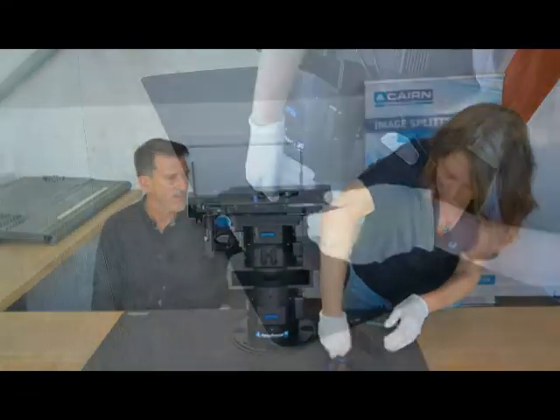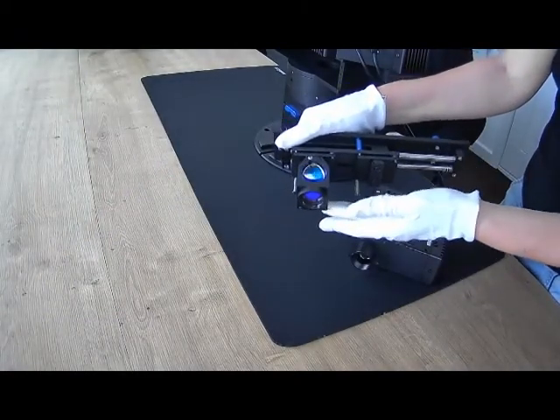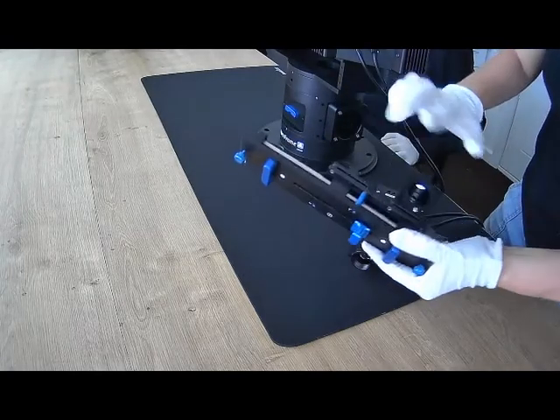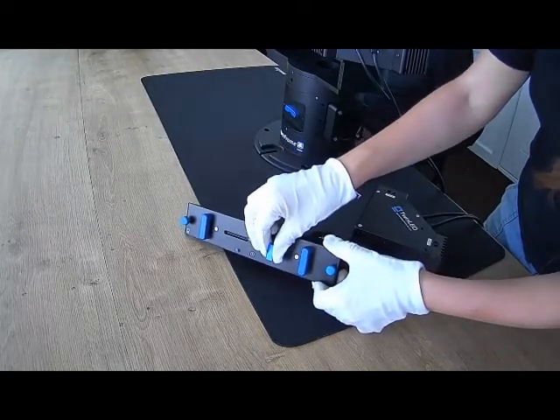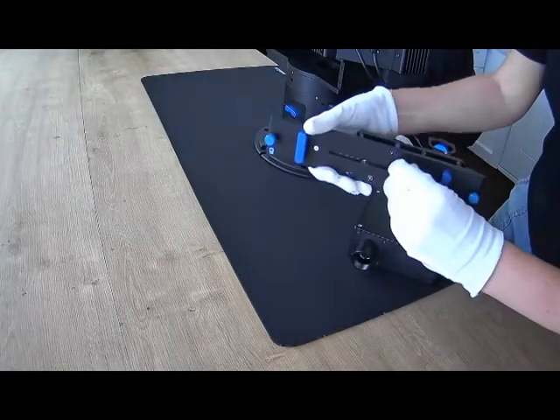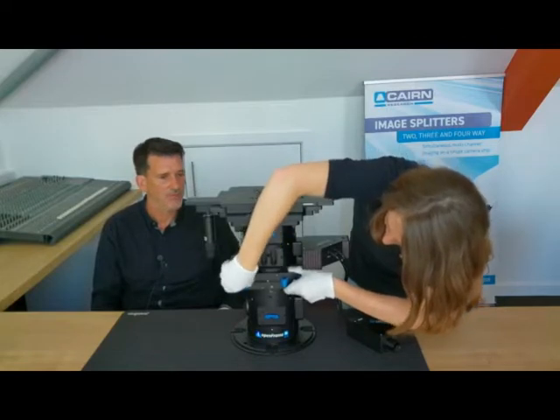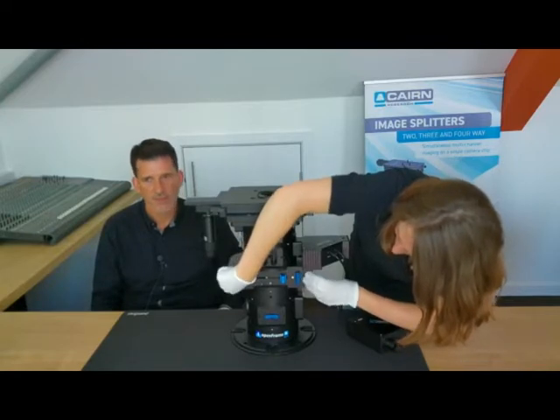Right, so as you can see here, I've just fitted it with 1 cube at the moment. It's our own design of Olympus style filter cube. It's got a clever little slider mechanism with 2 filter cubes and 1 blank. It's quite electrophysiology friendly. So it's got a bit of a bounce back mechanism on the slider, so it's not too clunky. Don't know if that shows it well. It's very easy to change filters in and out. As you can see, it's held in place magnetically, so it just slots back in, tightens up, and then you're good to go.